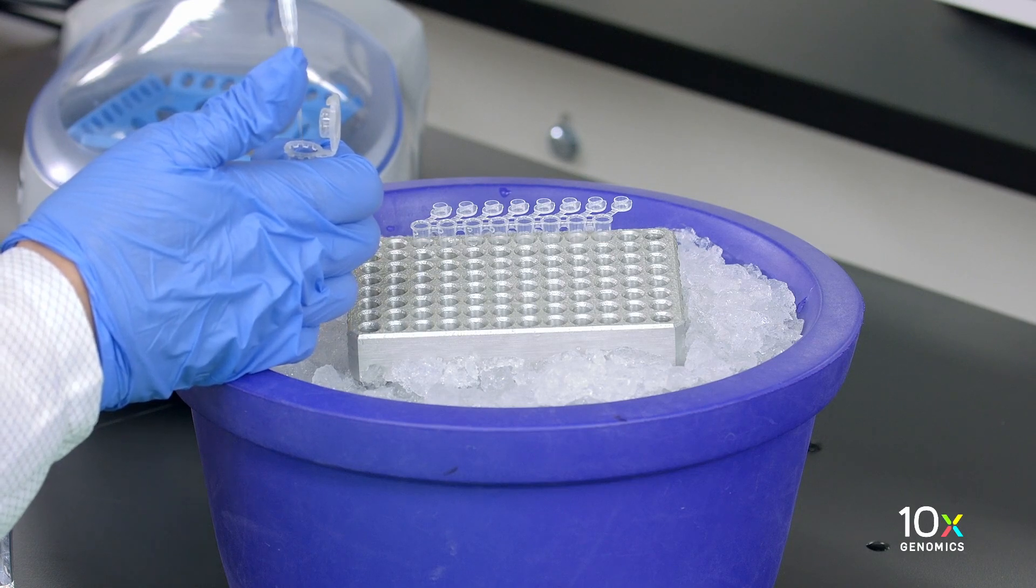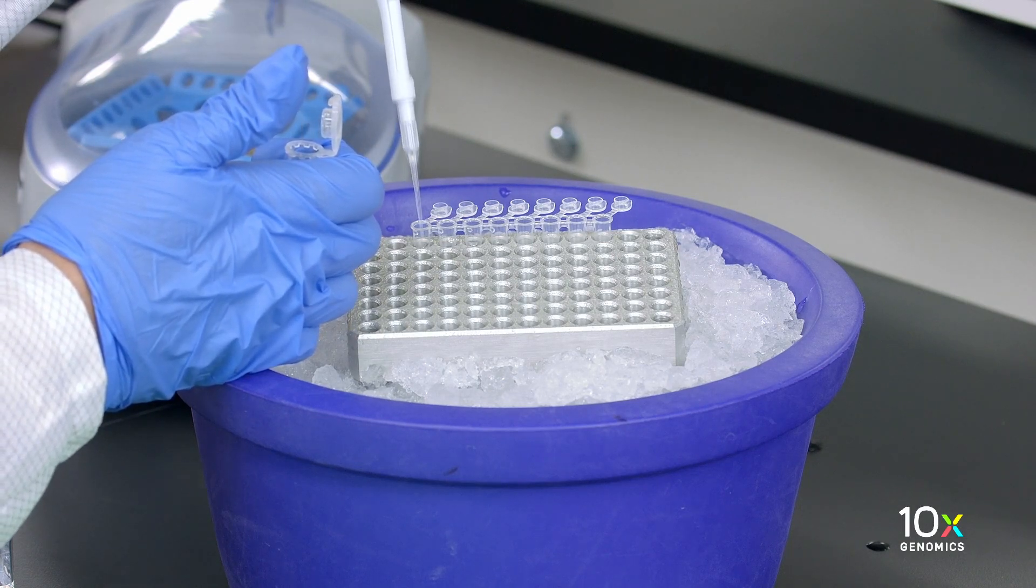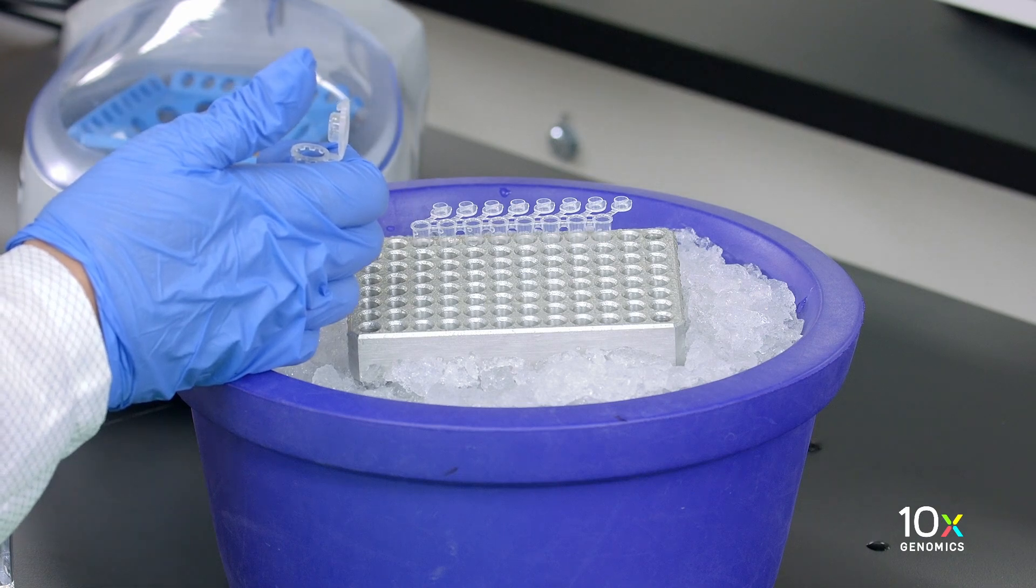When transferring the cells into the master mix hold the pipet toward the center of the tube and dispense them directly into the master mix containing the water.